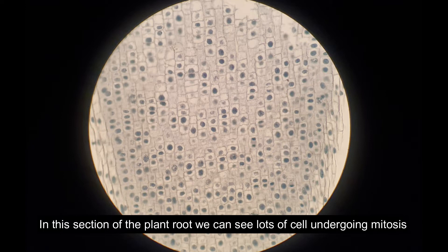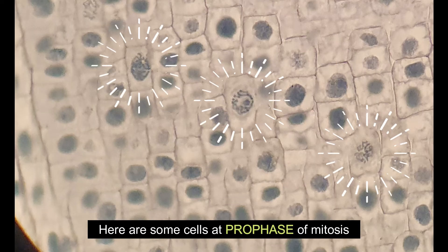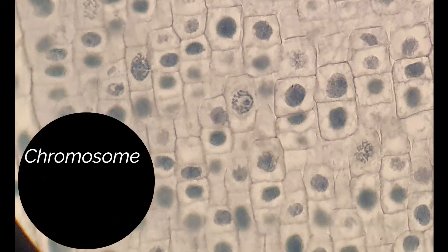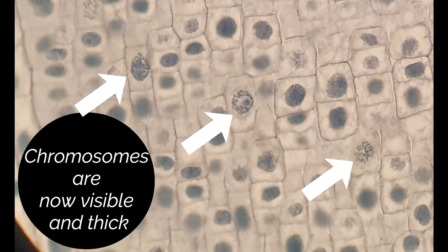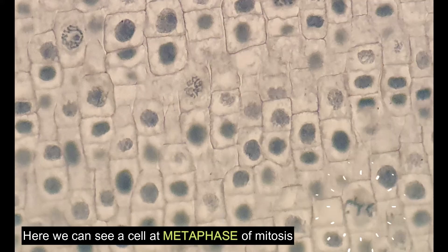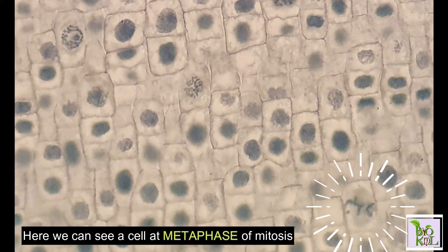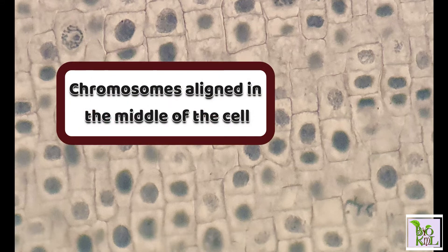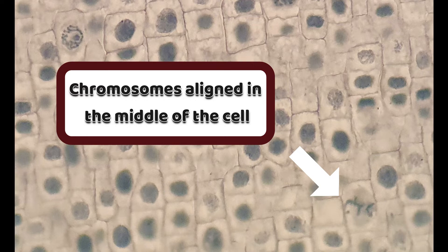Here are some cells at prophase of mitosis. During prophase, we can see that the chromosomes are now visible and thick. Here we can see a cell at metaphase of mitosis. During metaphase, chromosomes align in the middle of the cell.